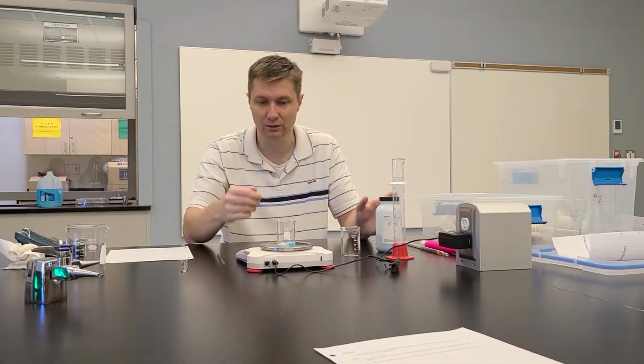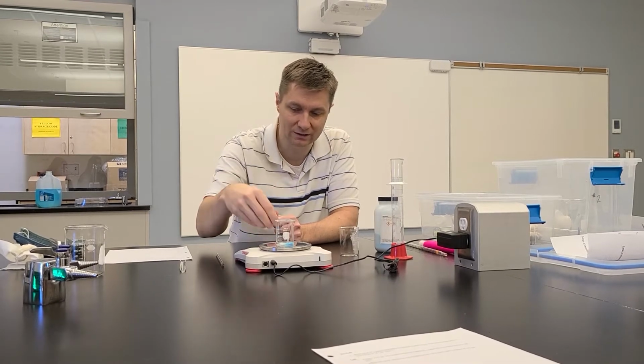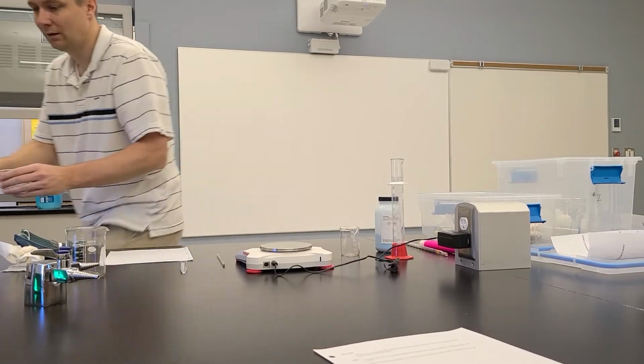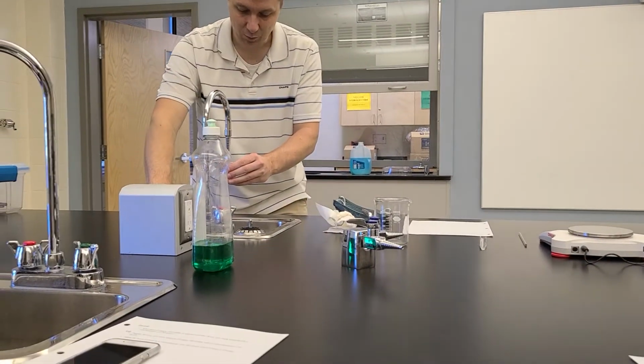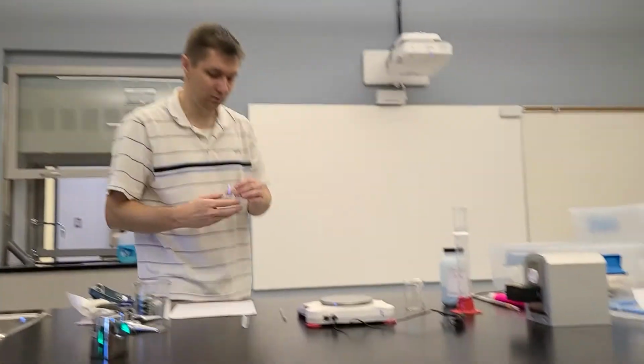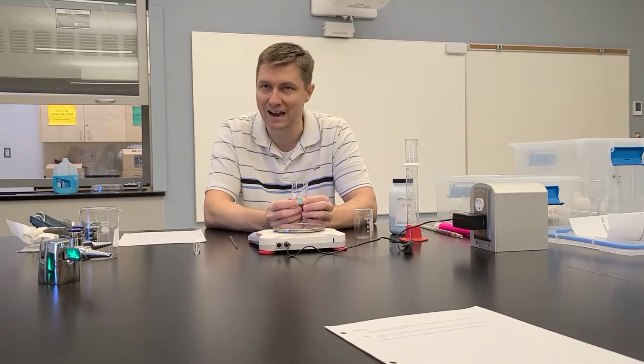Okay, so this is what the dilution looks like. Once you've got that calculated number, measure out what the mass is. This measures things out to the nearest 1/100th of a gram, so it's pretty accurate. And when you come over to the sink, just pour in a little bit of volume so that you can dissolve this. Now, with beakers, it's never a good idea to measure exact volumes.